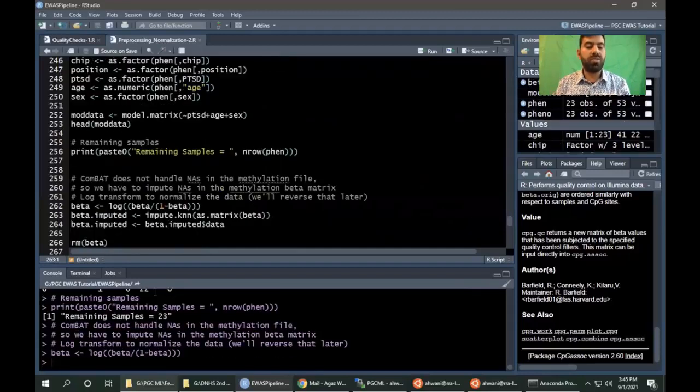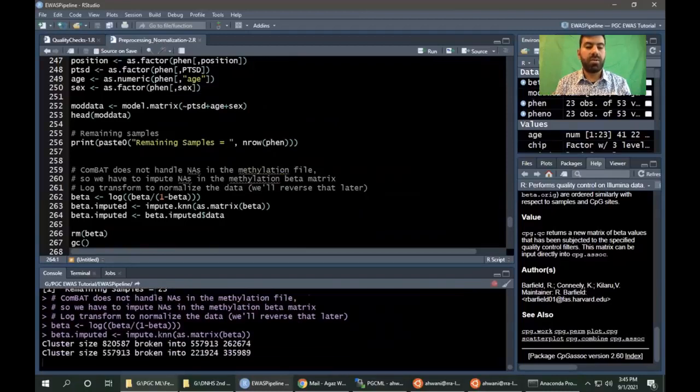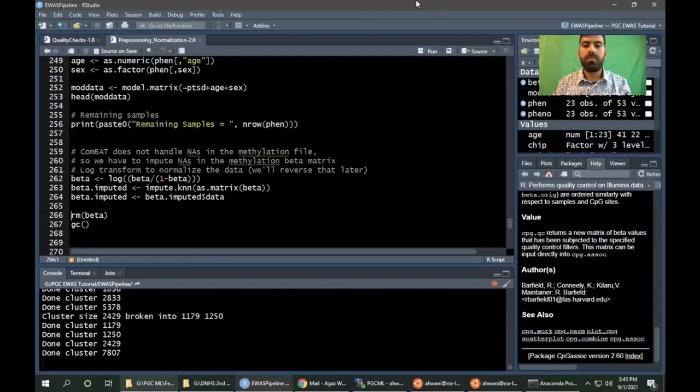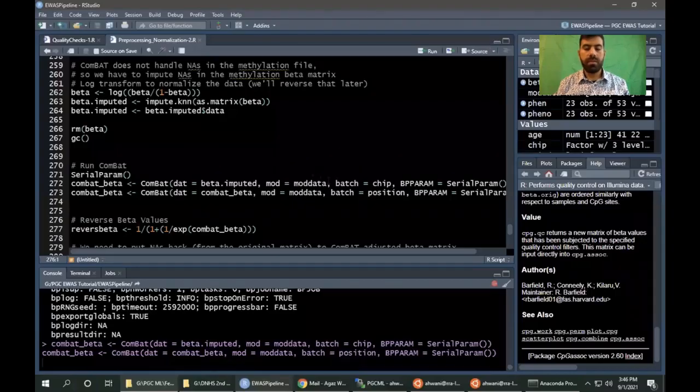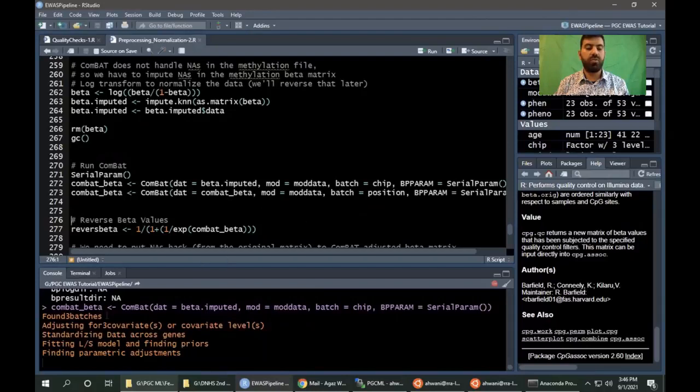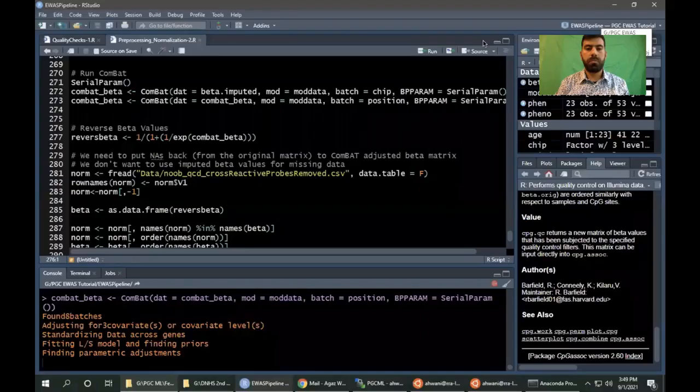We are performing log transformation so that we have a more uniform distribution of the data, and we will impute the missing values in the methylation data because ComBat will not work for data that has missing values. It's imputing the data right now. Here, the first adjustment will be done based on chip ID, and the output data will be used for the next adjustment, based on chip position. You can see we have 3 chips, so we have 3 batches being adjusted for batch effects. The data is then adjusted for chip position, as we have 8 positions on the chip, so we have 8 batches.